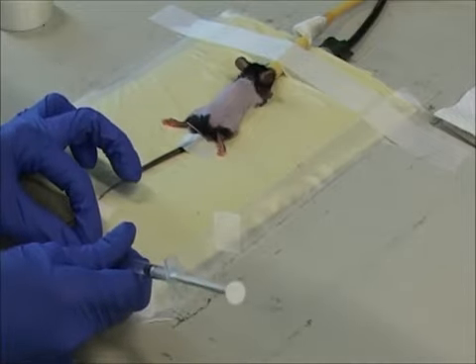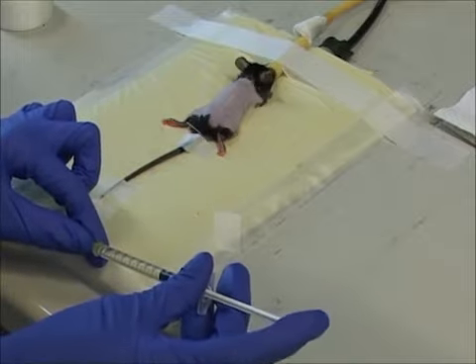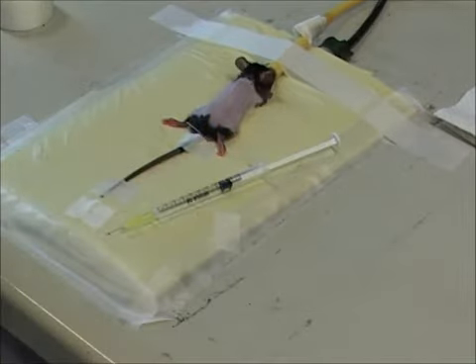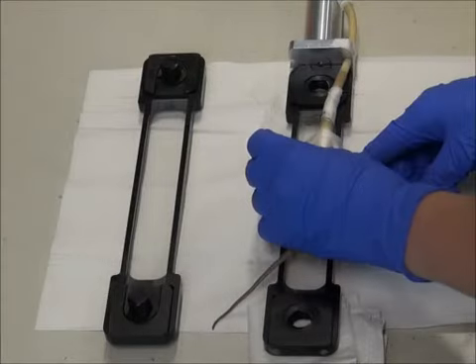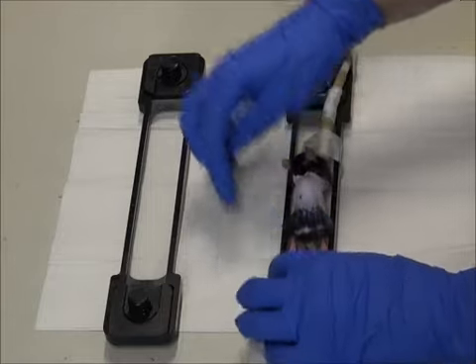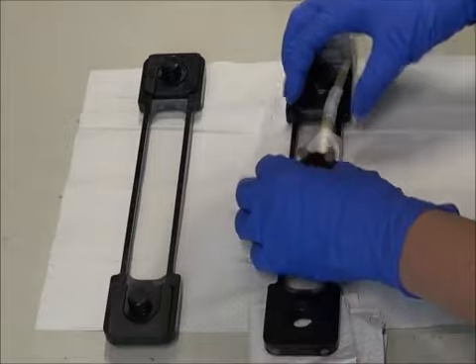To avoid volume overloading, at most 5 ml per kilogram body weight should be injected, which means 150 microliter for a 30-gram mouse. For scanning, the mouse is placed inside a multimodal mousebed. The mouse may have some symbols drawn onto the tail for identification. It is important to avoid such things on the torso, as it may impact the optical scanning.